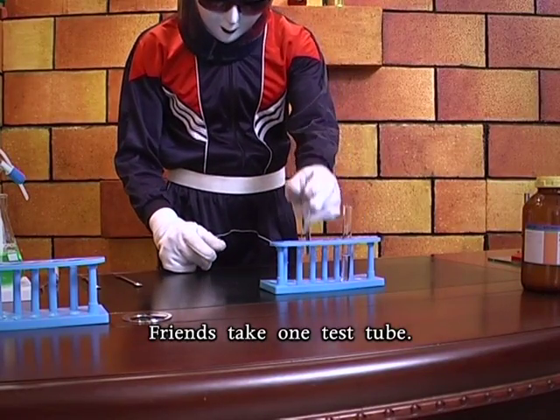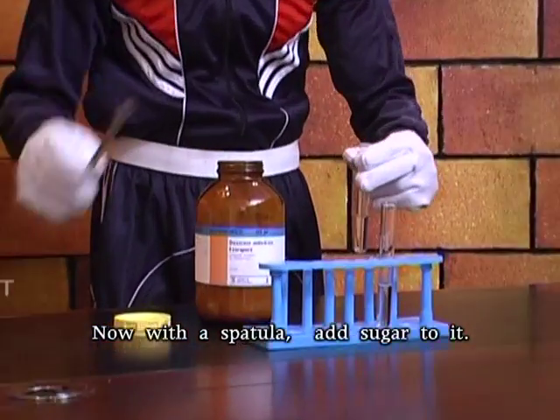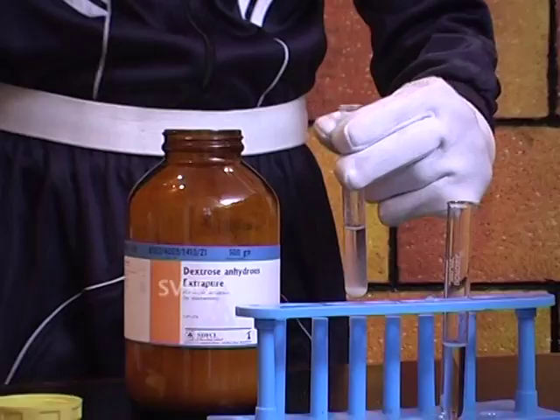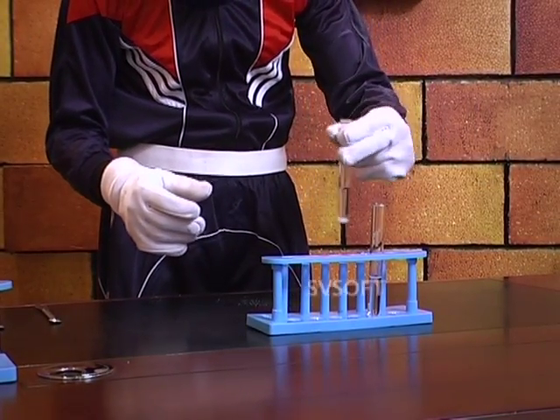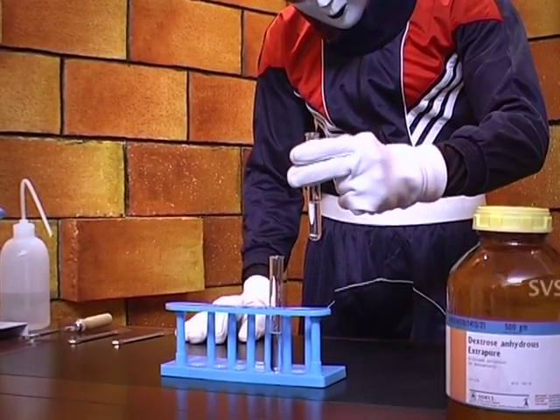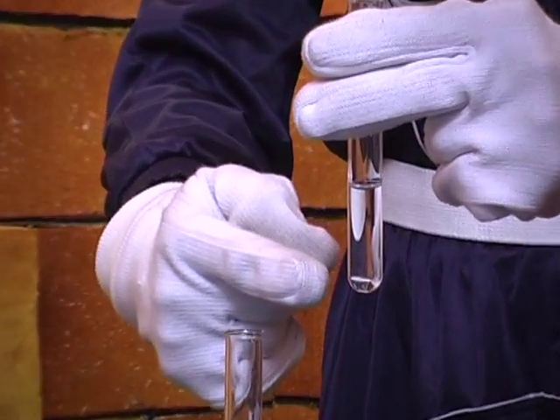Friends, take 1 test tube. Now with a spatula, add sugar to it. And shake well. A clear solution is formed, right?